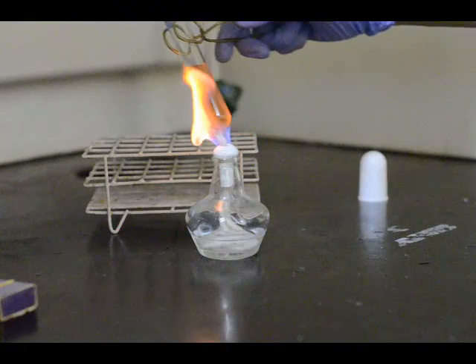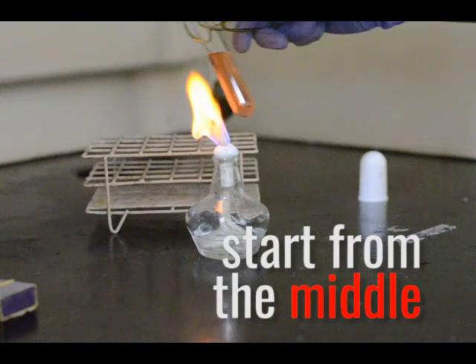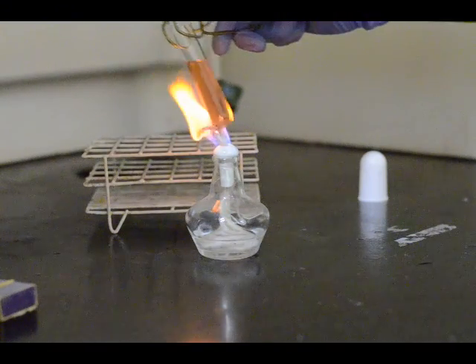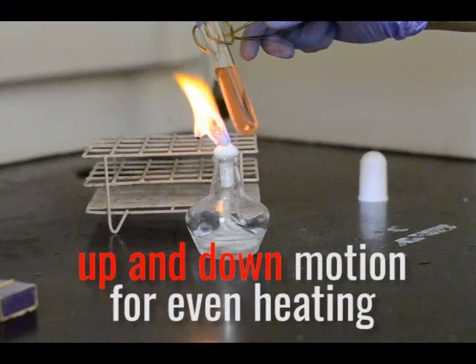He always starts heating the liquid at the middle, not at the bottom. He then subjects the whole liquid to even heating by moving the tube up and down.